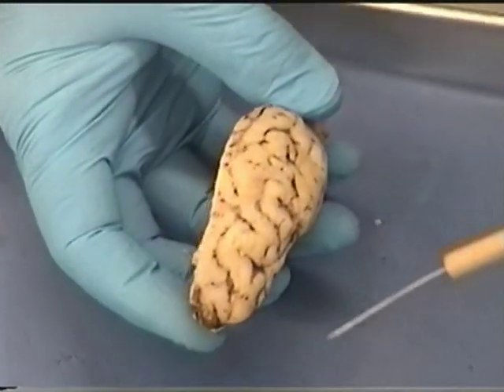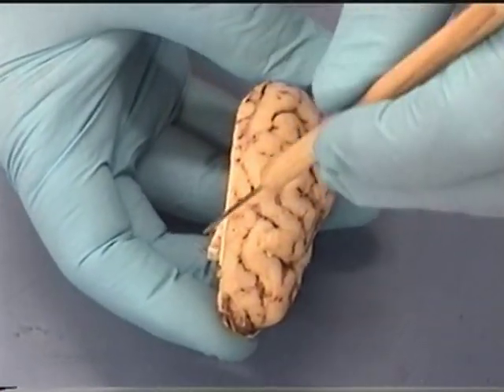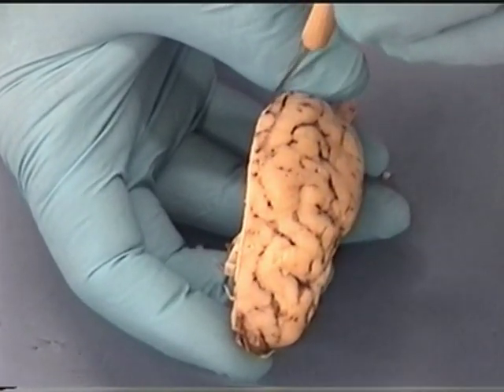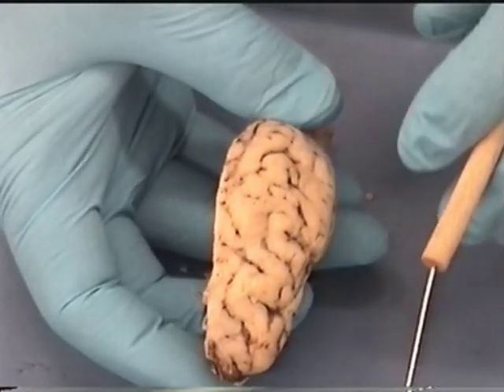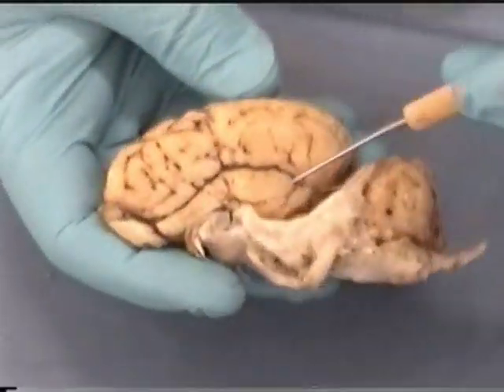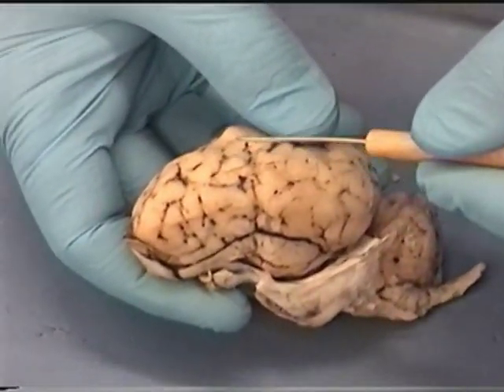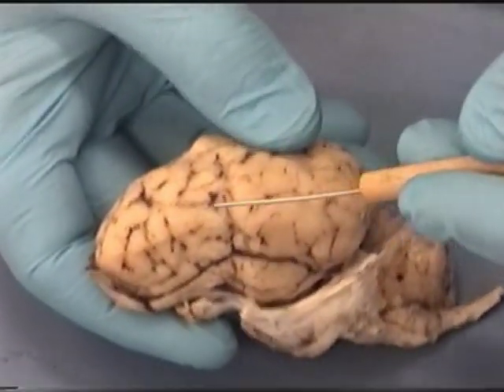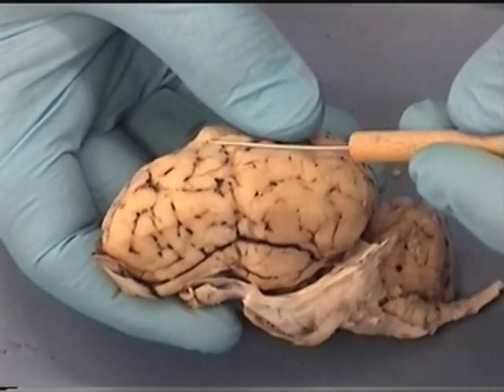When we cut this sheep brain, we cut down through a groove that separated the two hemispheres. We separated it via the longitudinal fissure. Just like in ours, although when you look at the pattern, there are fewer foldings on a sheep brain — that's why they don't take anatomy and you do. You get a lot more folding.